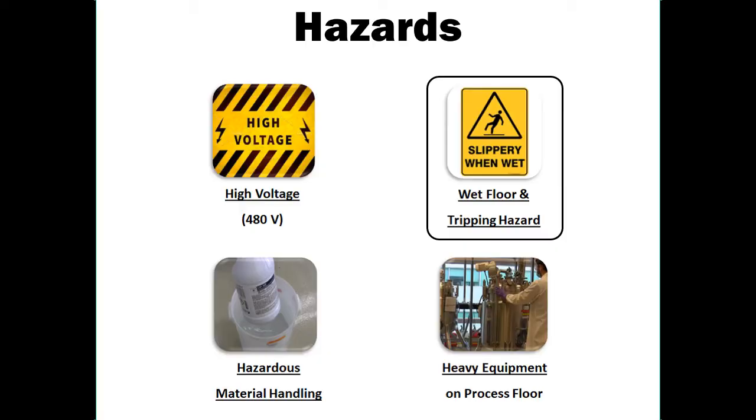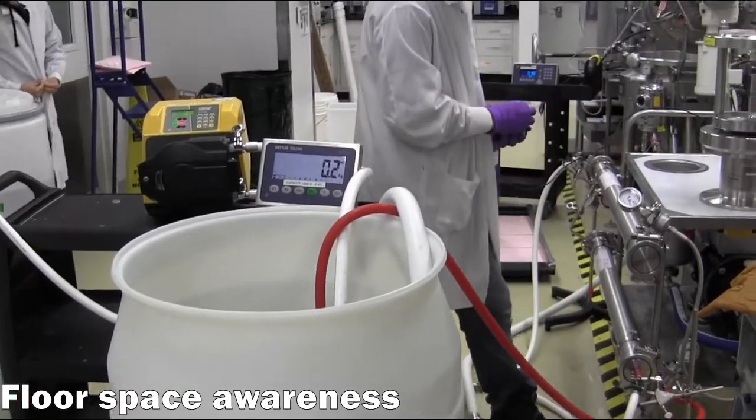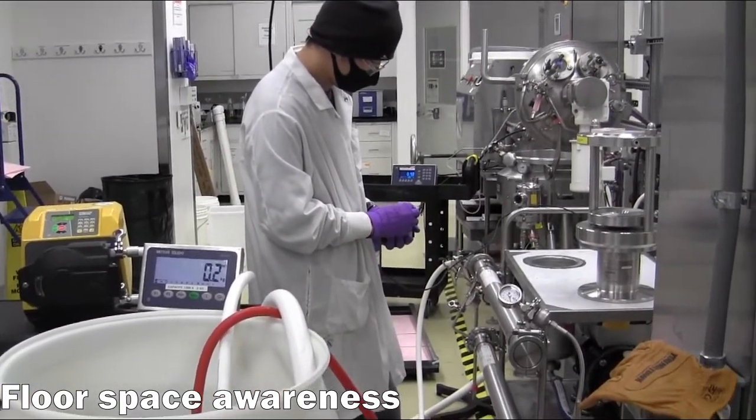The process floor may be crowded with various containers and hoses and the floor may be wet at certain times. Therefore, it is advisable to wear slip-resistant safety shoes and to be mindful of the appropriate paths around the equipment to avoid tripping hazards.